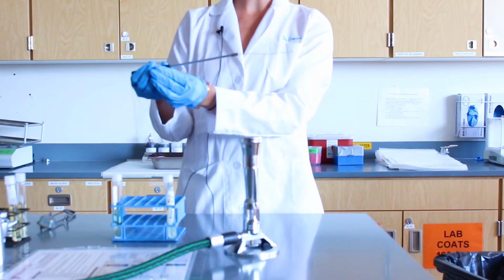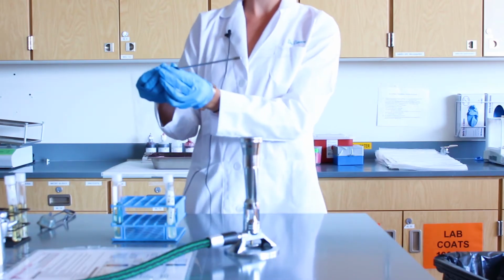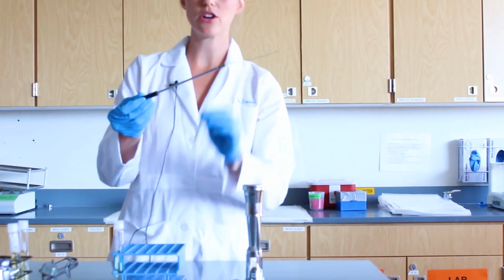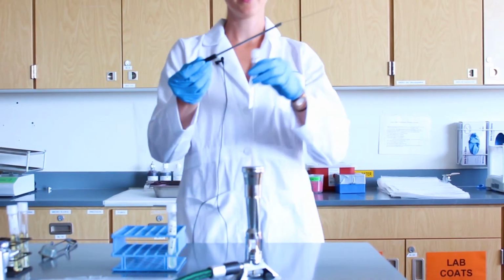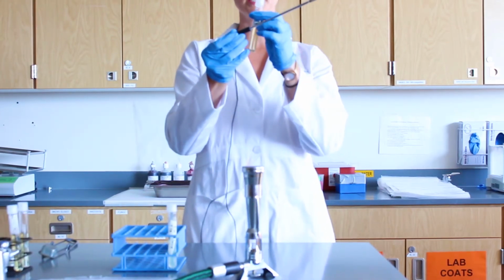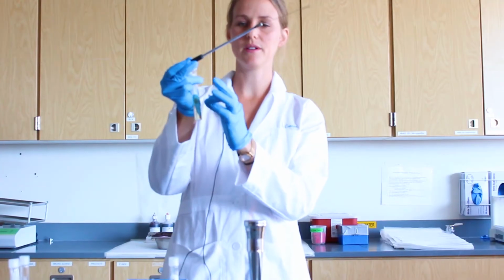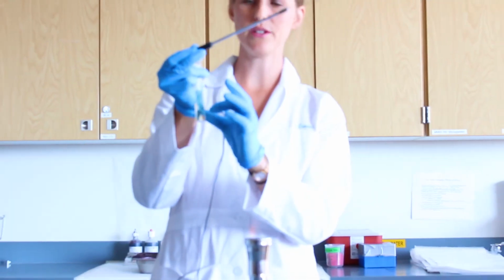Now that your loop is sterile, make sure to hold it still. Do not wave it in the air as you do not want to recontaminate your loop. You'll begin, again, by transferring bacteria in a broth into a sterile agar slant. Grab your bacteria growing in the broth. To make sure that it is evenly distributed throughout the broth and not just clumped on the bottom, you'll want to drum your fingers up and down the length of the tube. This should evenly distribute the bacteria throughout the tube.